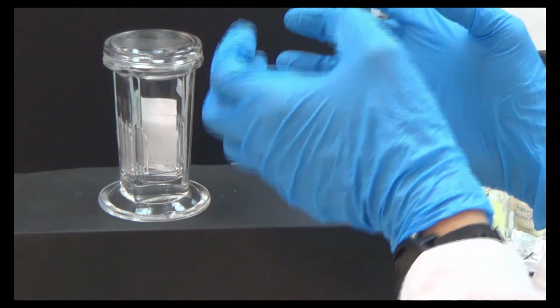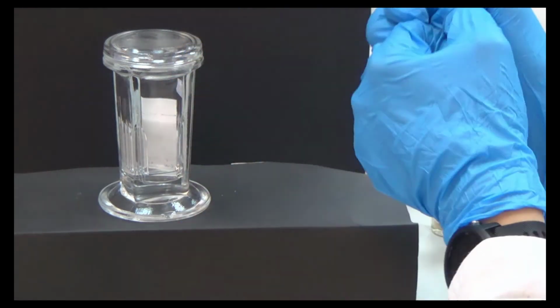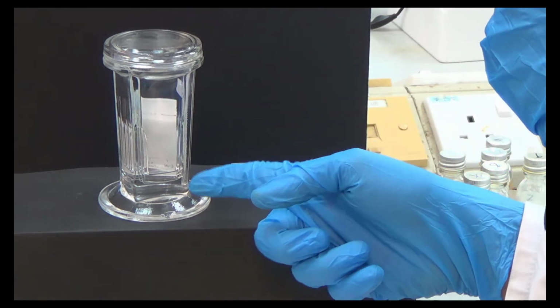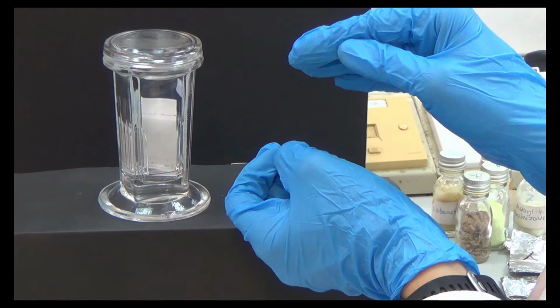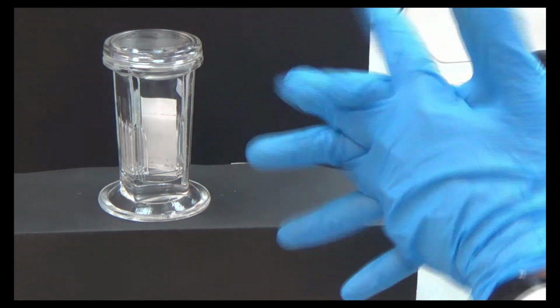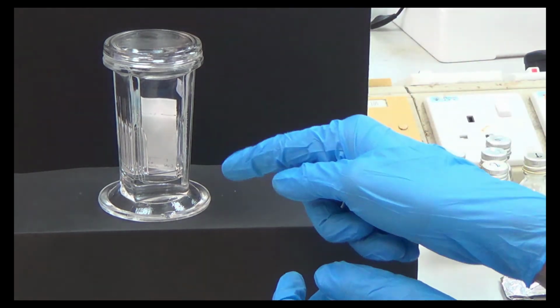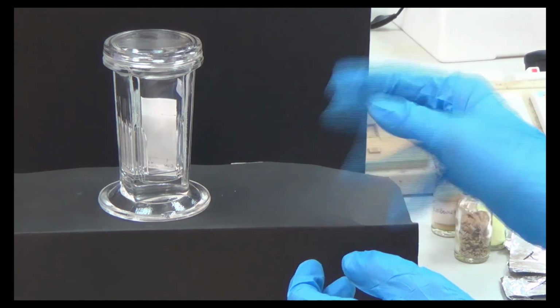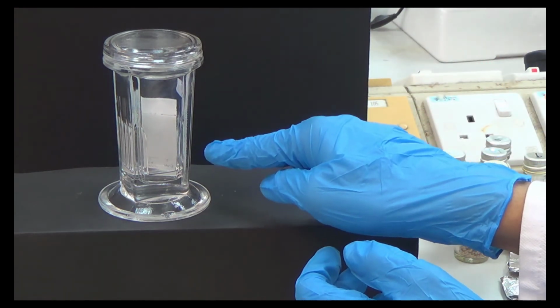So the silica gel holds them very dearly. Because it's polar and polar, it will hold them dearly. So if you try to kick with the mobile phase, the polar compound will move slower, will not move much, because the silica gel already holds them tight. So that's the idea. If you have two compounds, one polar, one non-polar, then normally the polar compound will be at the bottom, lower than the non-polar compound.